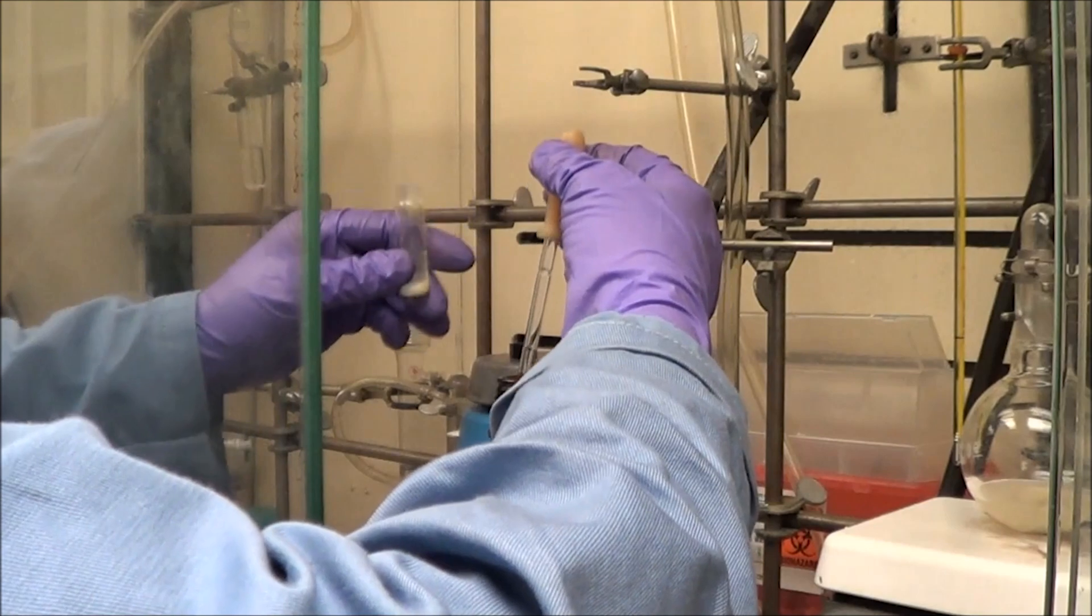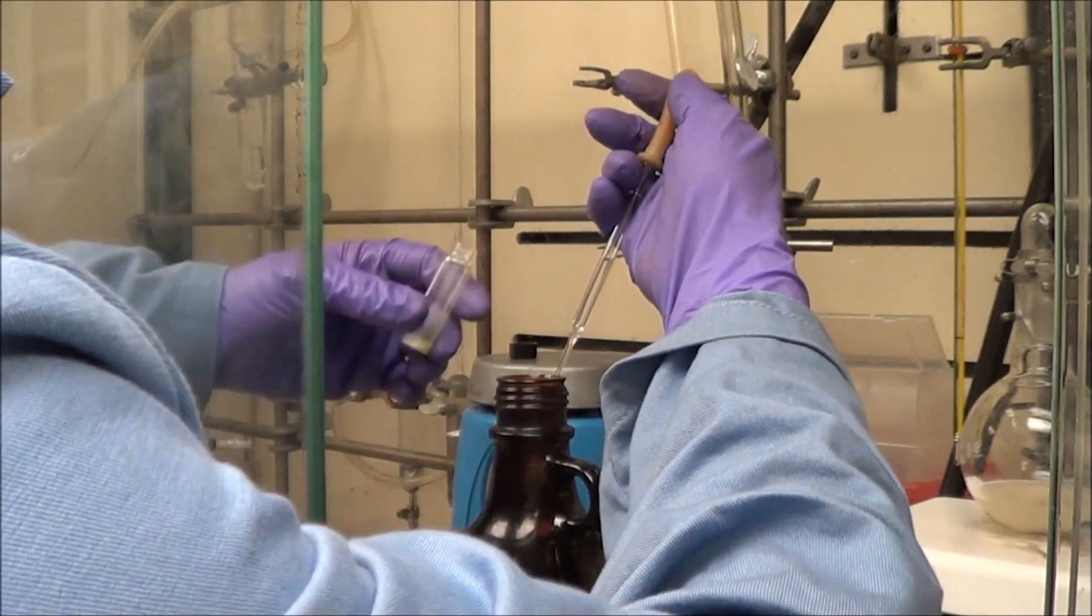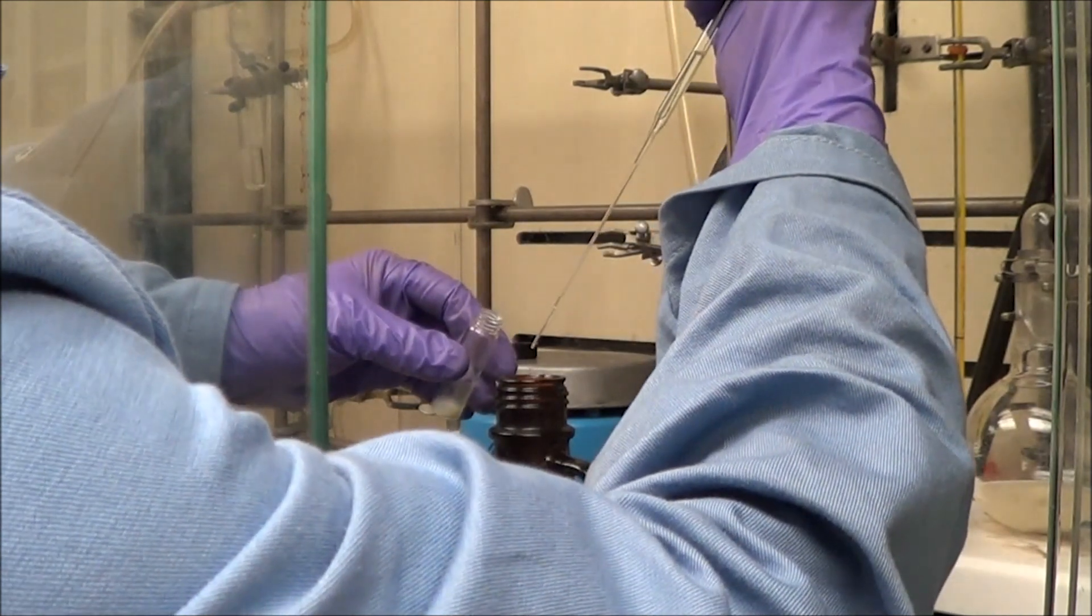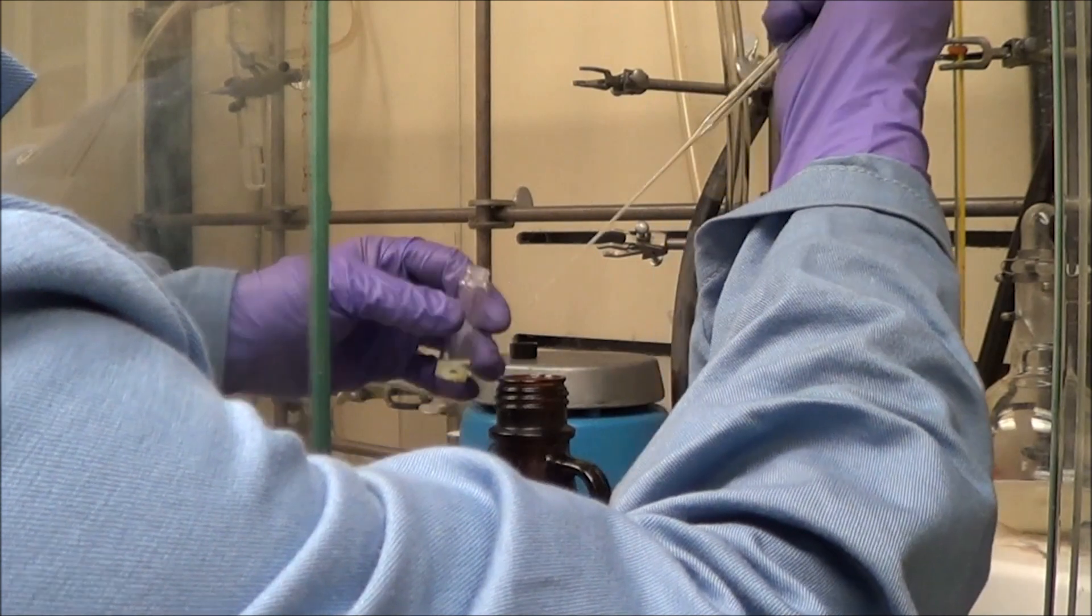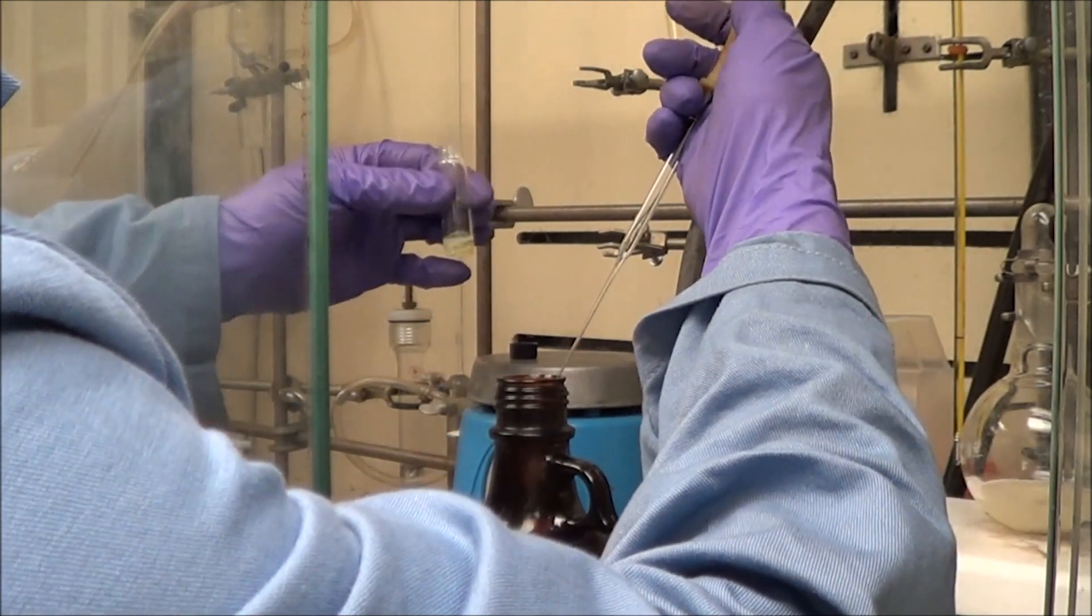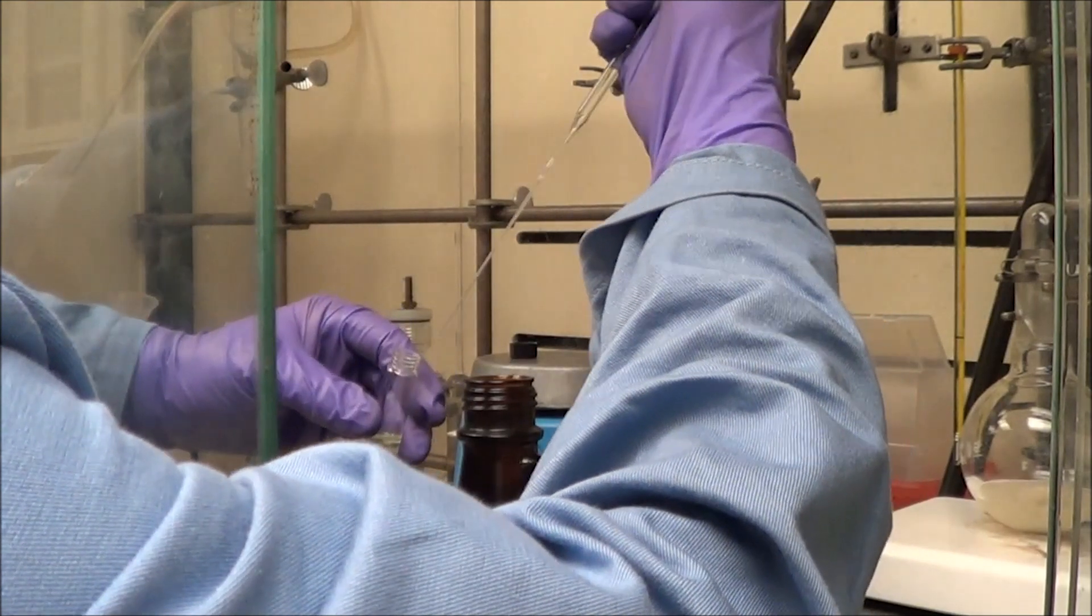Here's the cadmium sulfide, and we're giving it the same treatment. Chloroform, make sure the dots dissolve, and then you'll see here that I had a little bit more of a problem getting the polymer to dissolve with this one. You can see that a little better when I put it up to the camera.